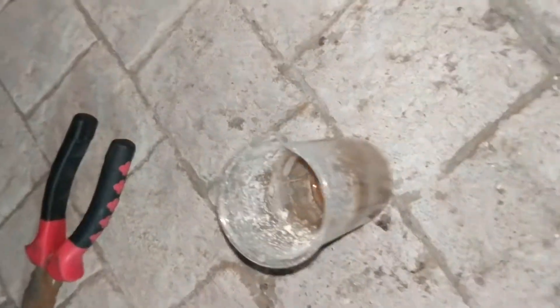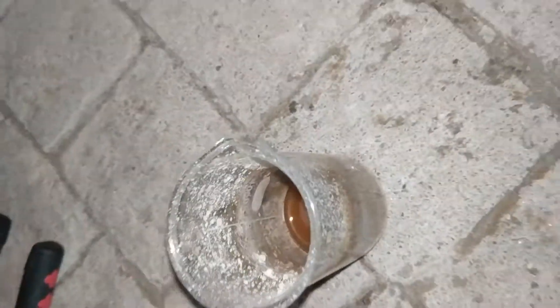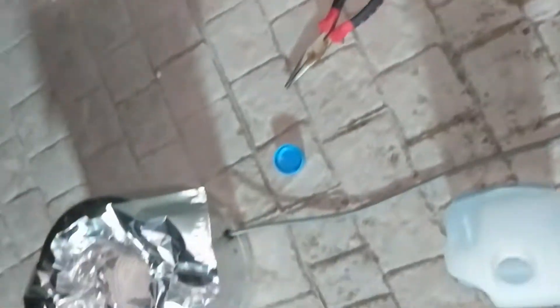Clearly what was happening is that as the water was driven off, it slowly melted at around 200 degrees because this thing gets extremely hot, and it just melted. As you can see, part of my silver nitrate has decomposed, which is not very good.